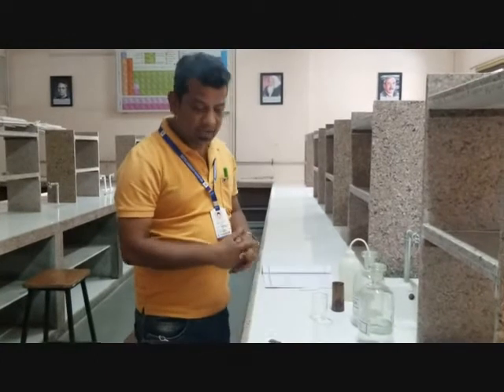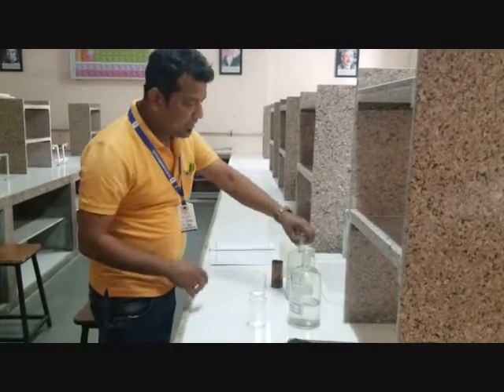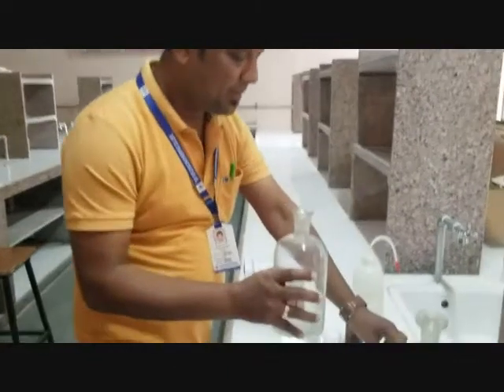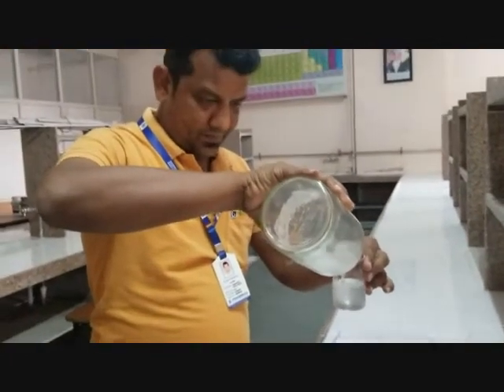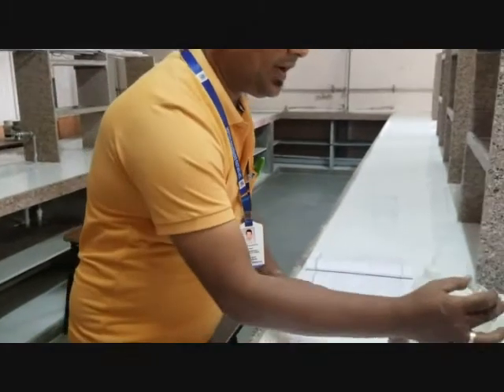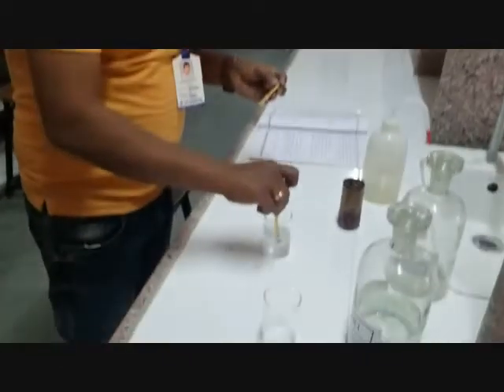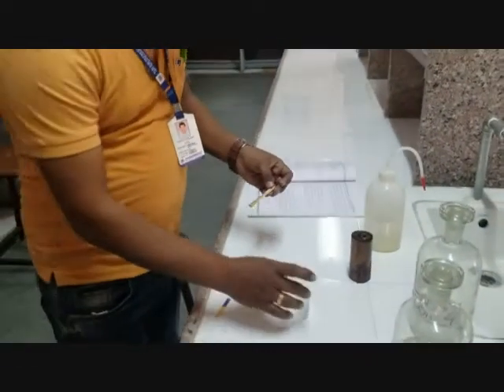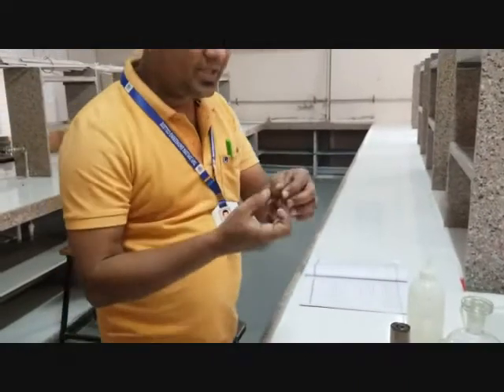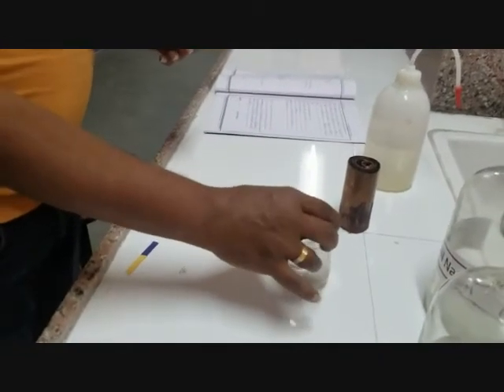Let's start our practical by weighing this copper strip. First I will take the NaOH solution, which is our basic medium, in this beaker, and measure the pH of this basic medium solution using pH strip. Our pH is 10.5. We will dip our first foil in this basic solution for 60 minutes, for 1 hour.